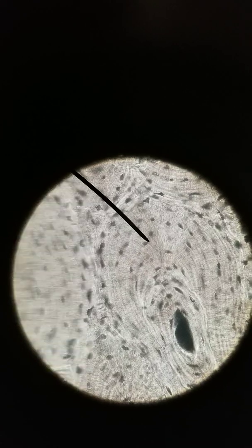I'm just going to try to go to 1000x, see if this works without oil. Not well, never mind. But what I want to show you are really, really tiny. I guess you can see it here. Great. Really, really tiny lines extending from those osteocytes. Those black lines make it look like a spider. Those little black lines are called canaliculi, in other words, little canals. Those canaliculi allow blood to reach these cells.